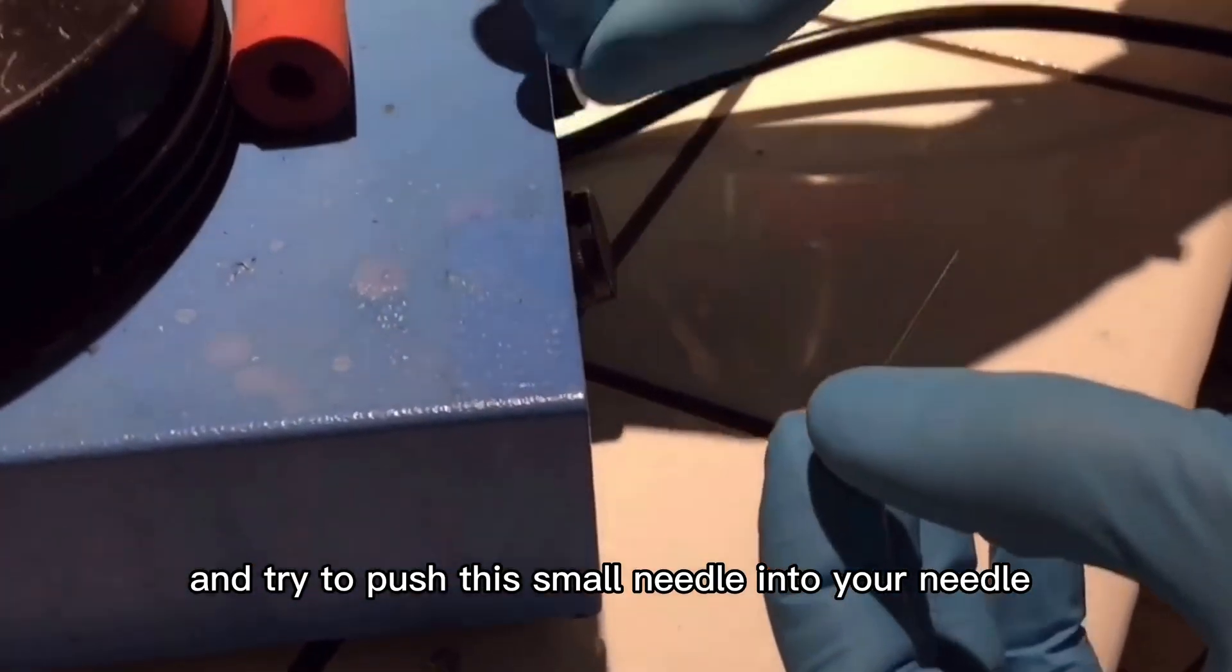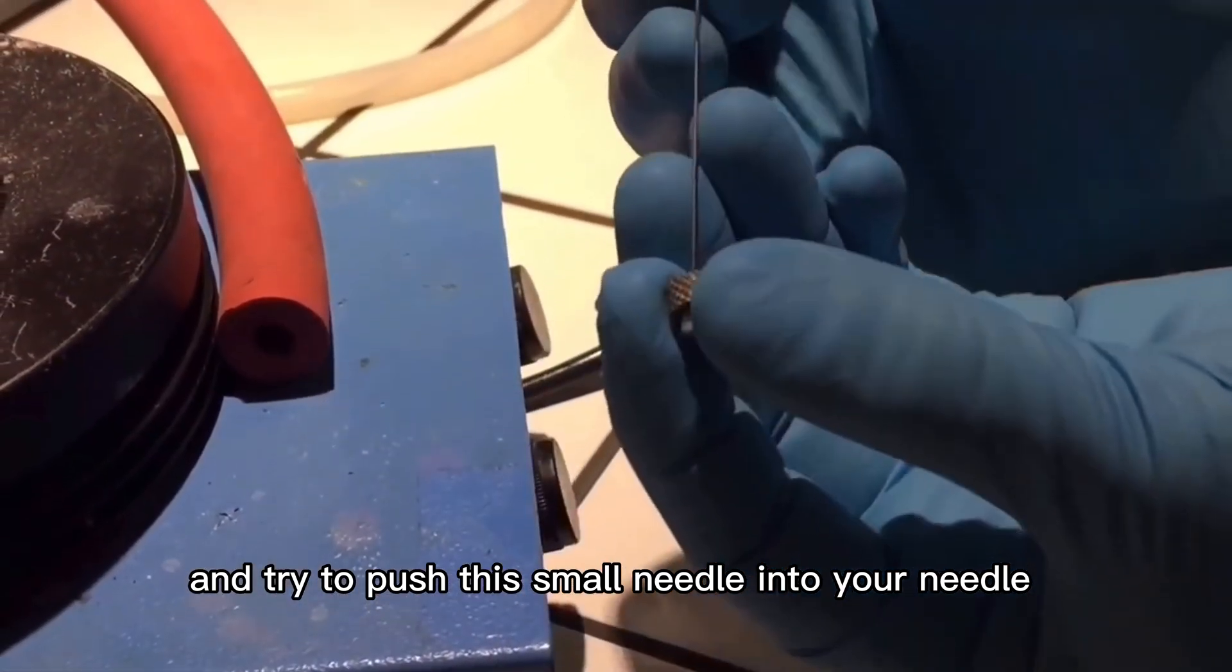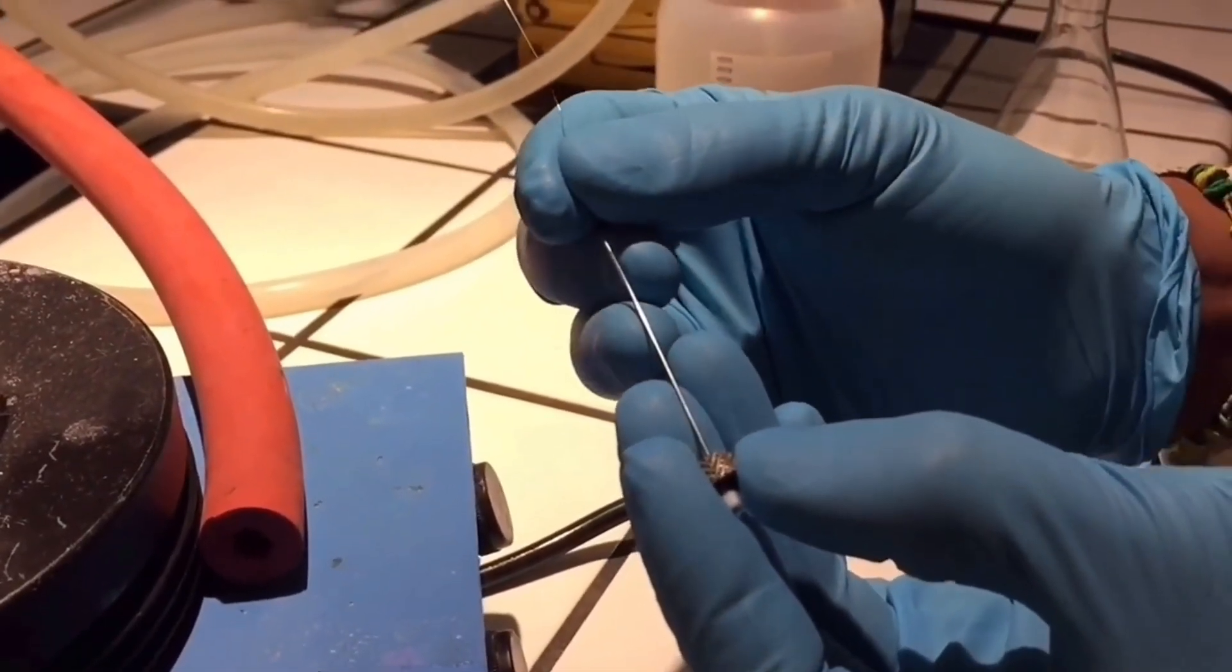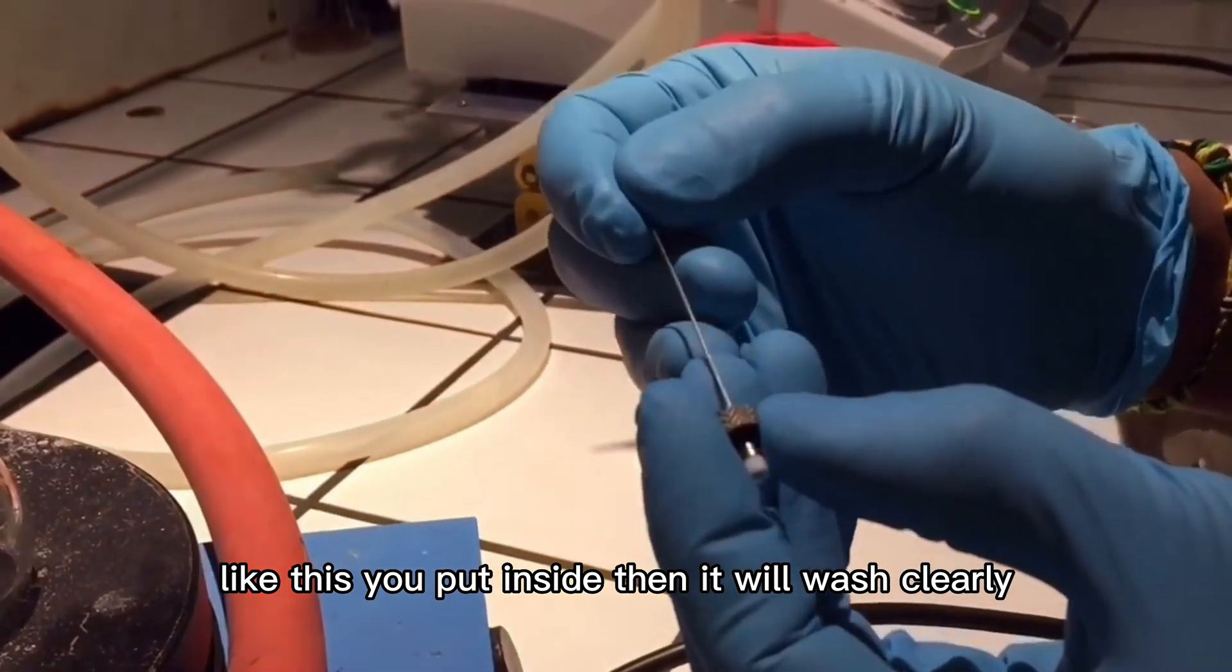Try to push this small needle into your syringe like this. When you put it inside, it will wash clearly.